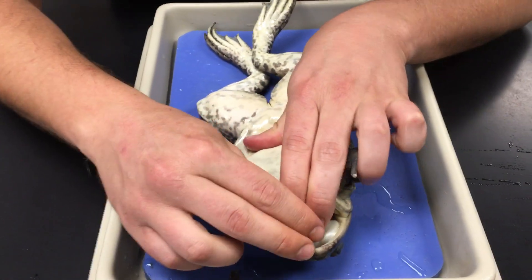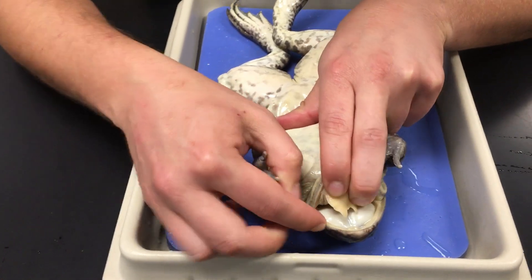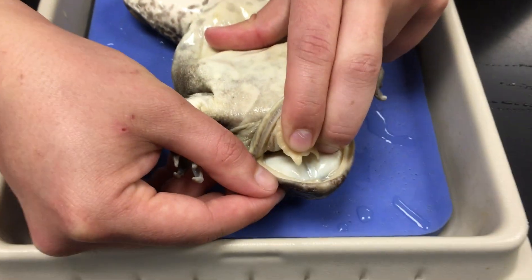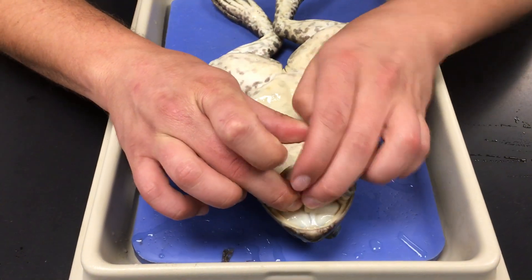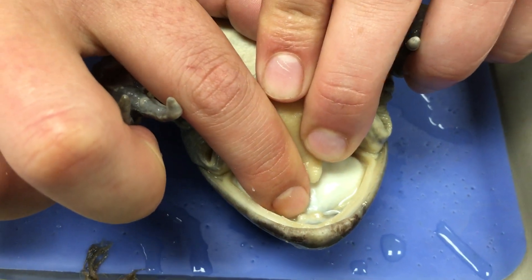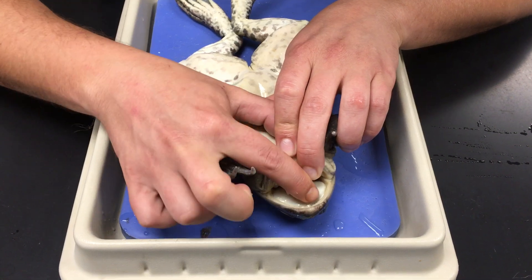The first of these are the maxillary teeth on the upper surface of the jaw. You'll notice it has these very fine, almost sandpapery-like bumps — these are the maxillary teeth, and the maxilla is what comprises your top jaw. Just behind the maxillary teeth, we have another pair of bumps called the vomerine teeth. Here we also have the openings for the nares — the nostrils.